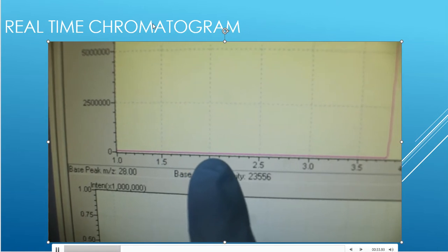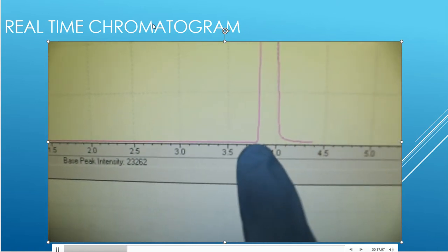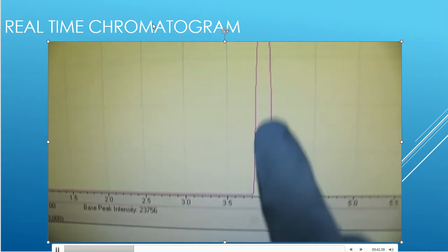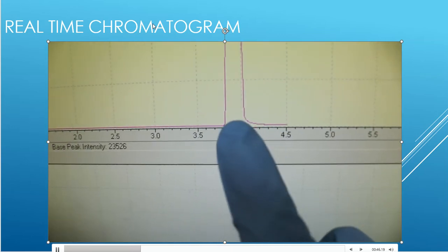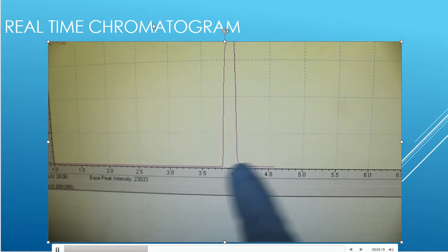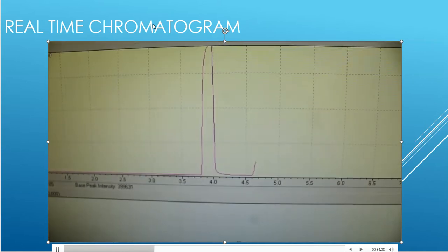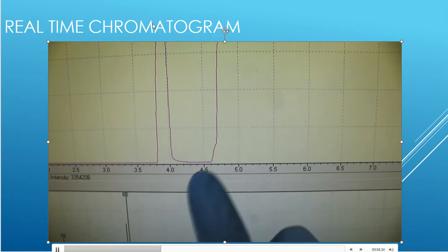That's what we like to see, so nothing's coming through, and then all of a sudden, ding ding, we have a compound that shows up, and that compound, whoop, all the way up and whoop, all the way back down. So this is a sign that the mass spec has seen something. What it has seen, I don't really know yet, because this is just a visual of the chromatogram as it's getting generated. But look at this.